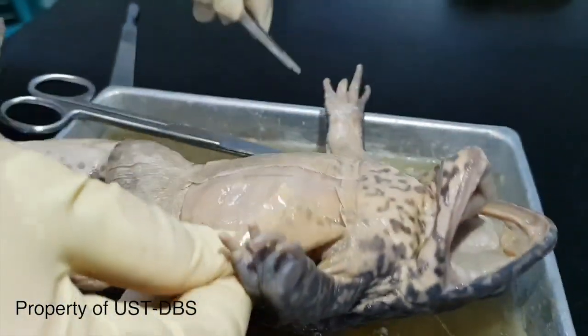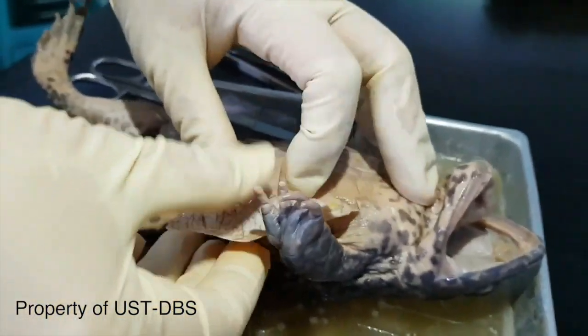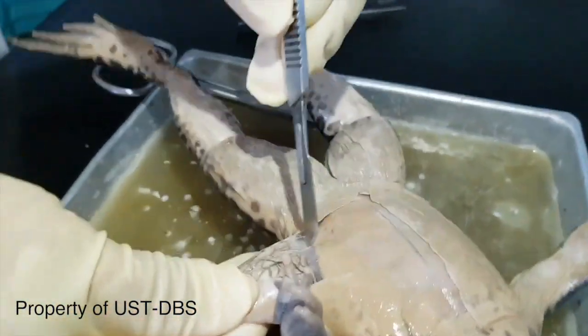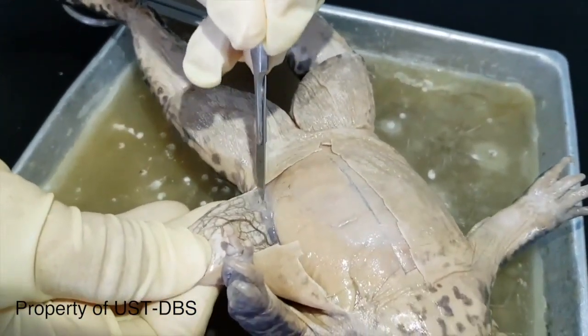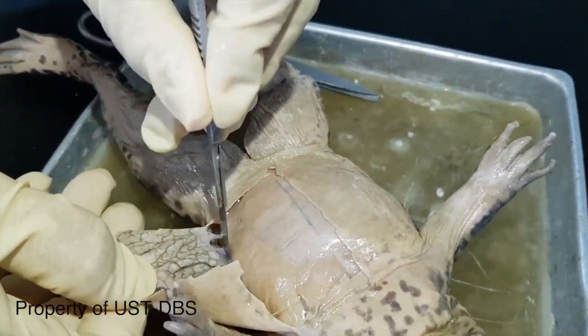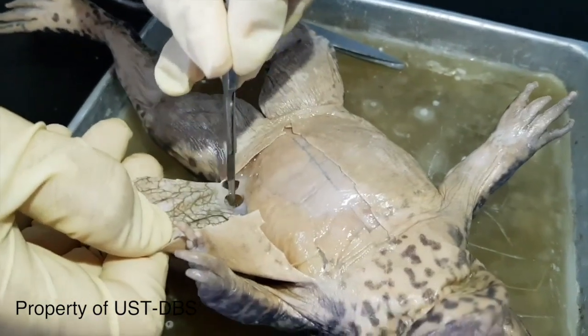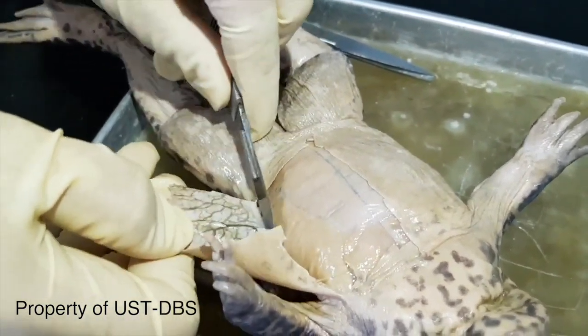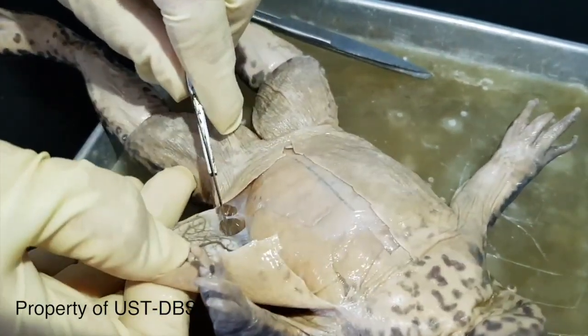So what you're going to do is remove it slowly, and take note that there is some fascia that attaches the rest of the integument with the underlying muscle. So you can just remove it slowly, not to damage the muscles.